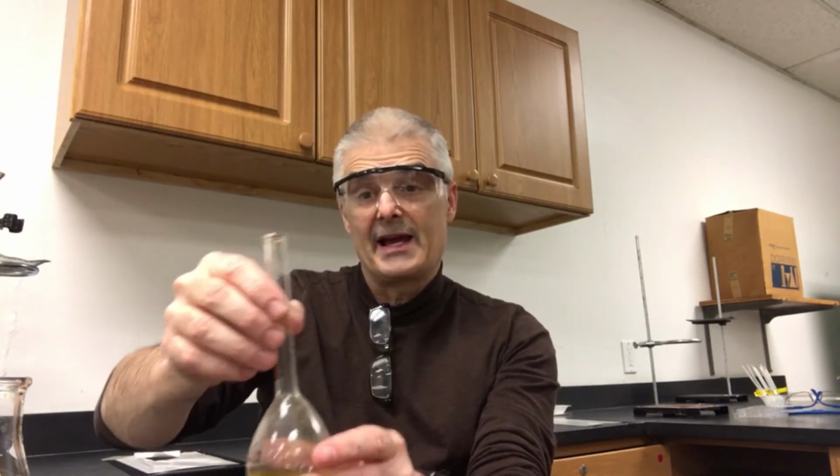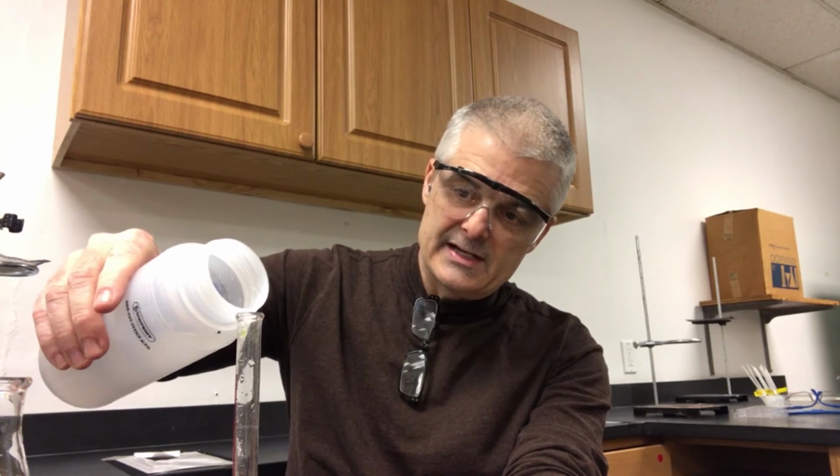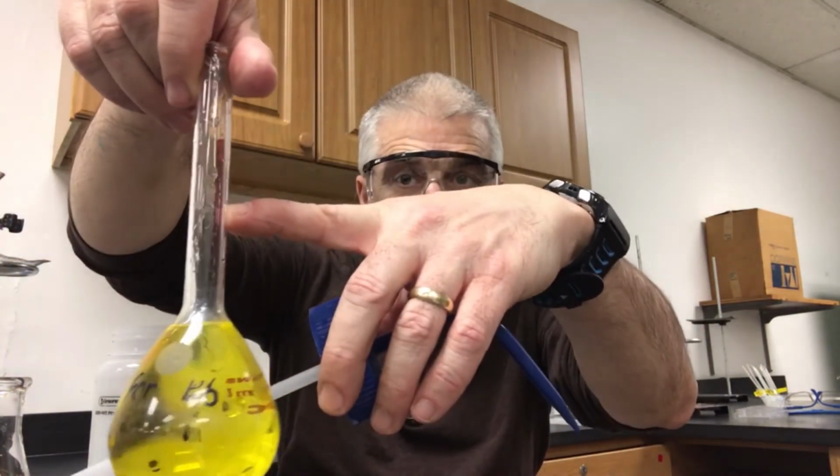Now this is a 100 milliliter volumetric flask, another super accurate device. And then what I can do is fill this up. Actually, what I often do, I'll cheat, is pour the water in directly, but I'll slow way down when I get to the end. All right, so now, I don't know if you can see this, but I'm at the tip of the neck, but the actual line is right there.